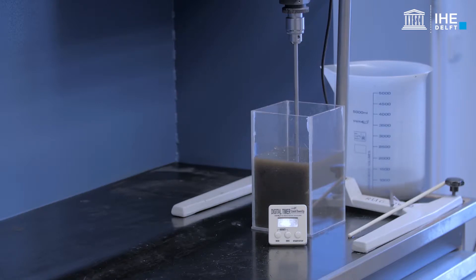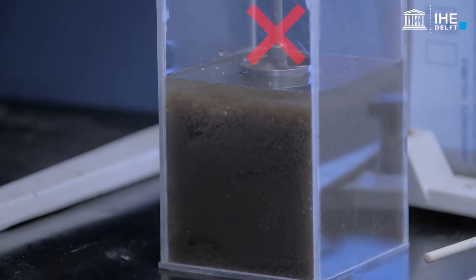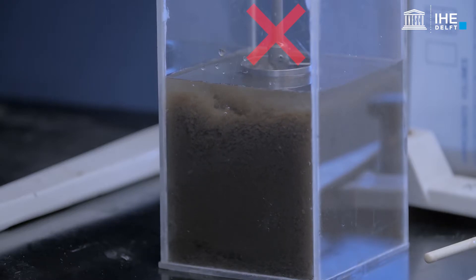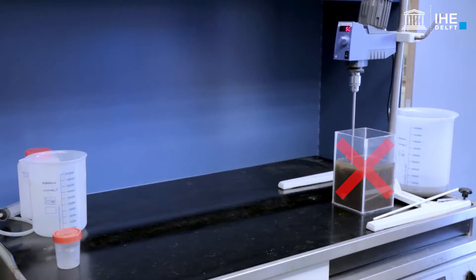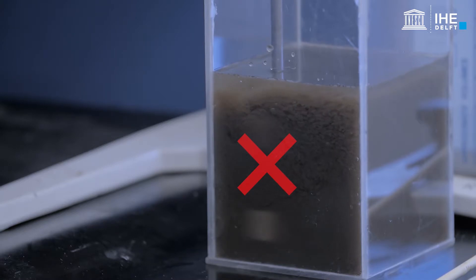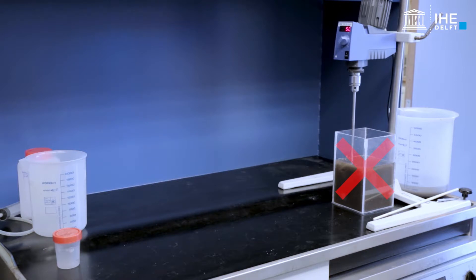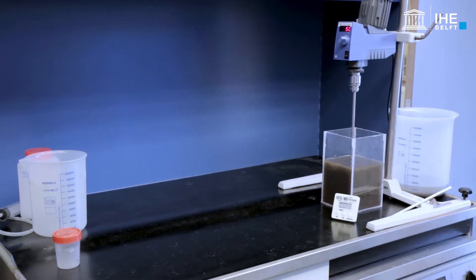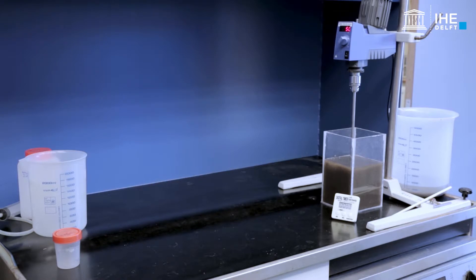Check visually that the entire sample is well mixed. After 30 minutes, turn off the mixer.